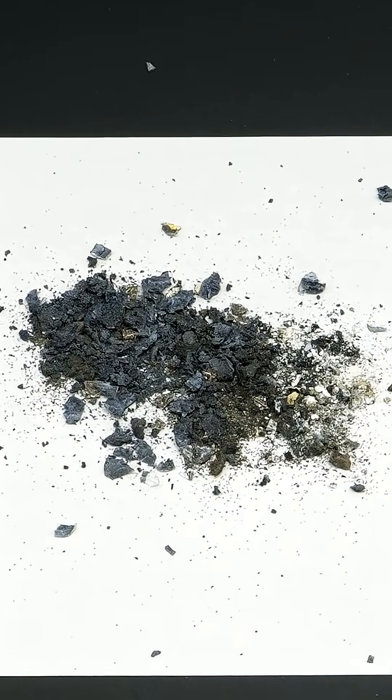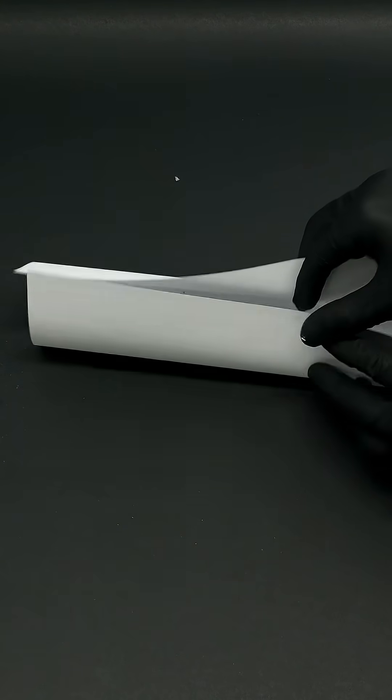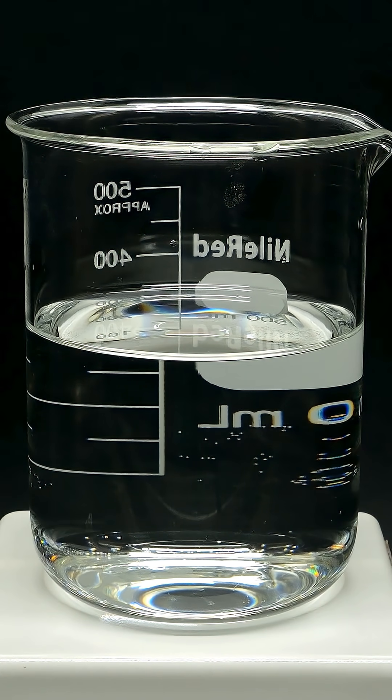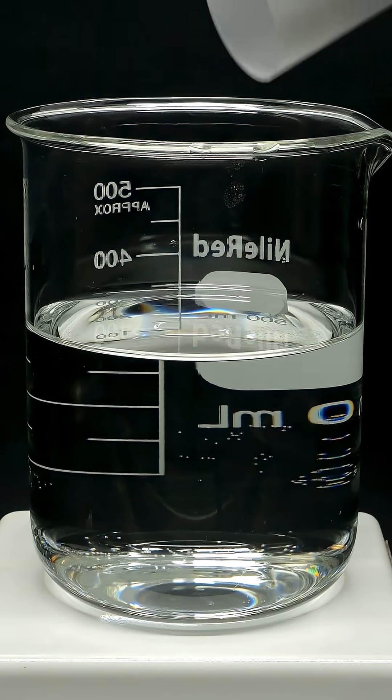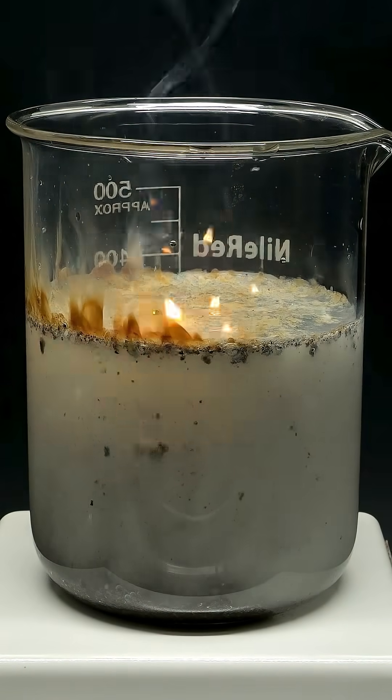Now it's finally time to make my spontaneously combustible gas. All I have to do is take this powder and dump it into some mildly acidic water, and almost immediately I'm presented with a bunch of little fireballs.